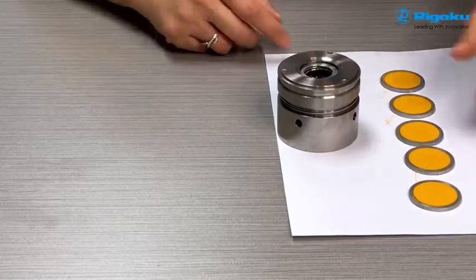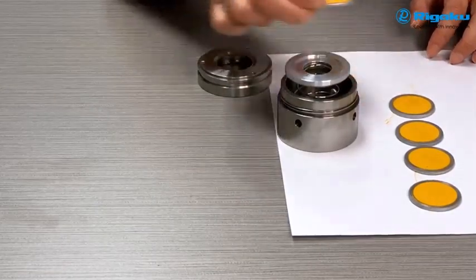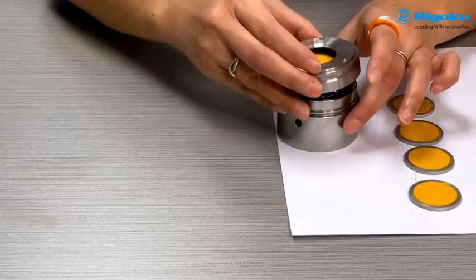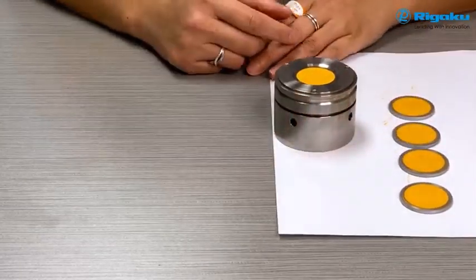Okay, now that we have our standards pressed, what you want to do is load it into your sample holder, and we're going to create a calibration curve. This is on our tube above. Of course, we have a tube below too. We have a benchtop system that has a separate cup.